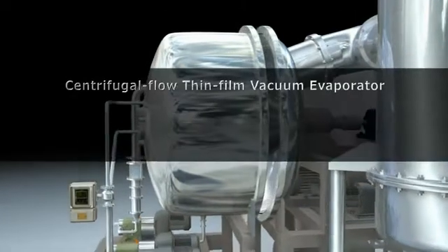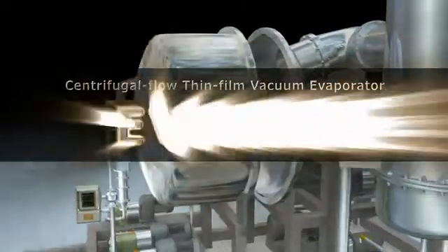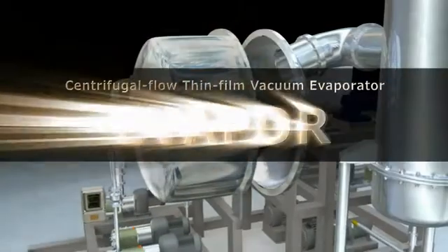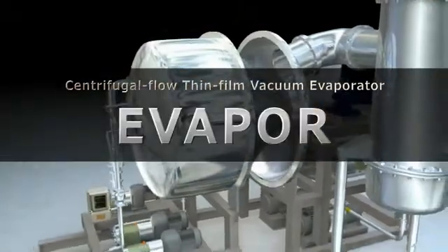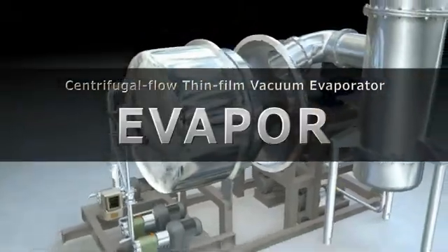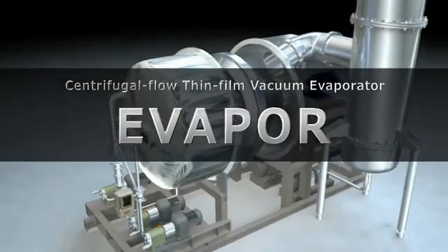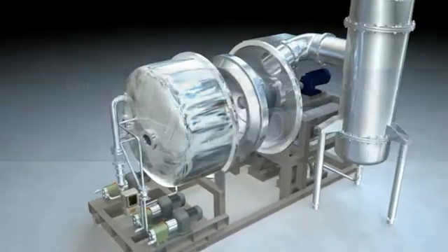The Evapor is a centrifugal flow thin film vacuum evaporator. This unique evaporator can process liquids at low temperatures with no degradation in quality.